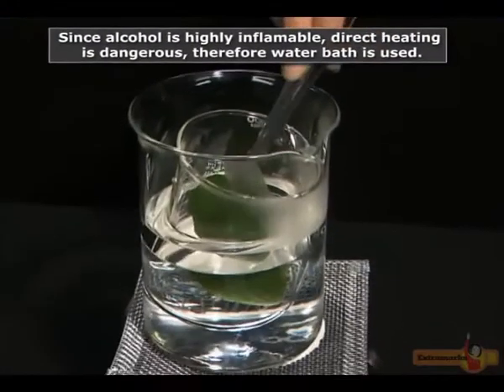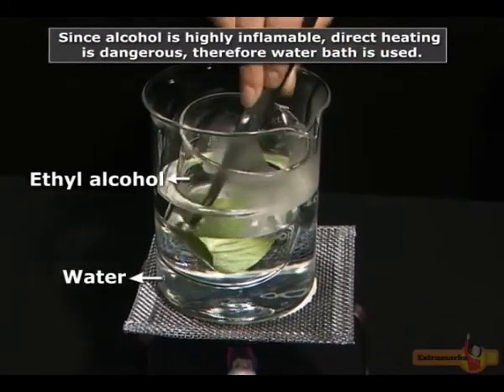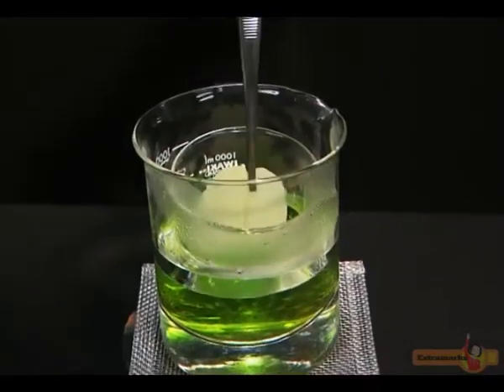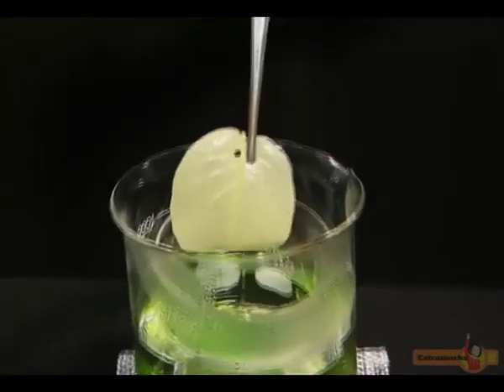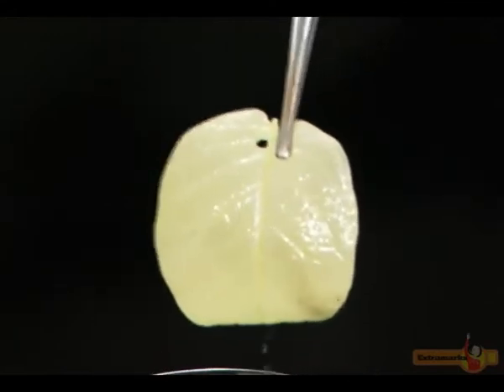The leaf is then put in ethyl alcohol to dissolve the chlorophyll. The leaf gets decolorized due to the loss of chlorophyll pigment and becomes pale yellow in color.